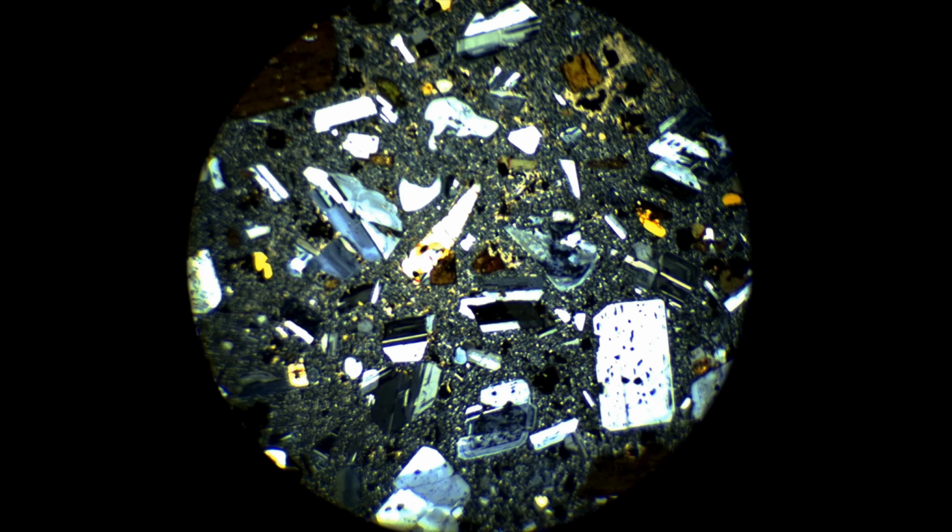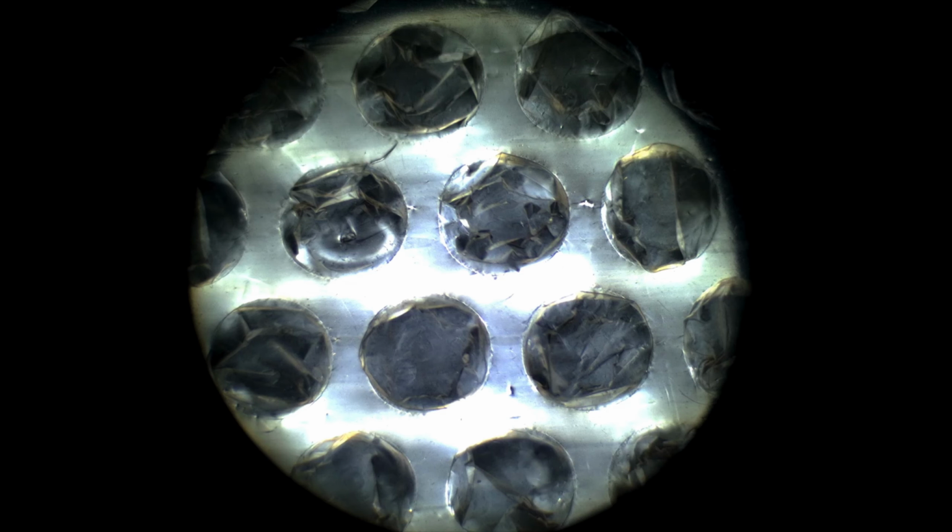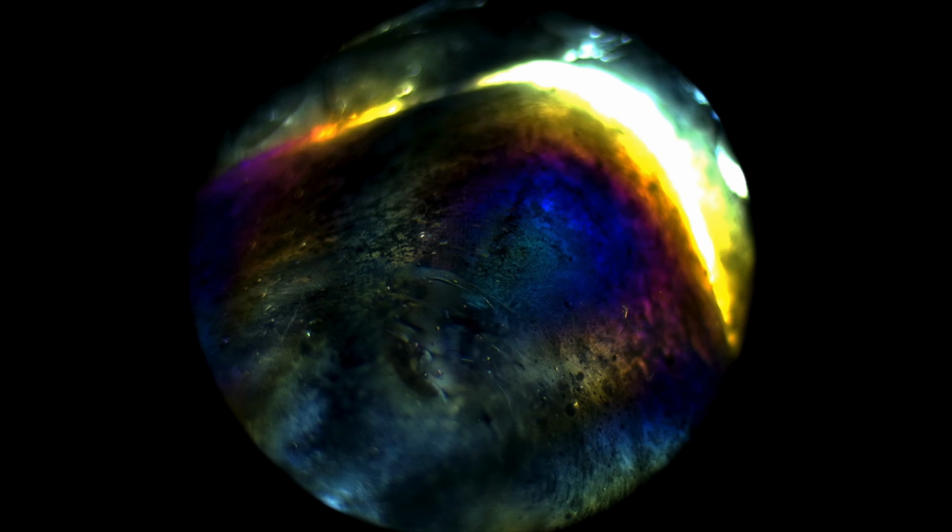and crystals. Analysis of material structures. Polarized light makes it possible to distinguish textures and fiber directions in minerals and polymers. Quality control and authenticity verification in jewelry examination and forensics. The method allows one to distinguish between natural and synthetic stones. It also helps to detect composites and imitations.